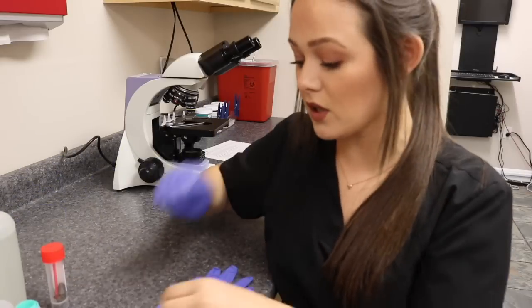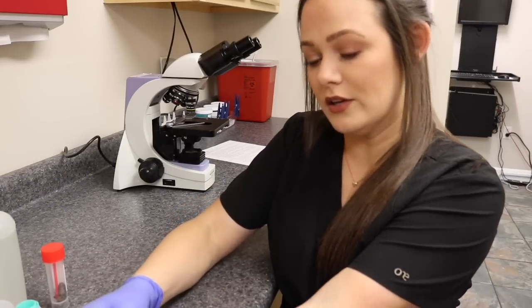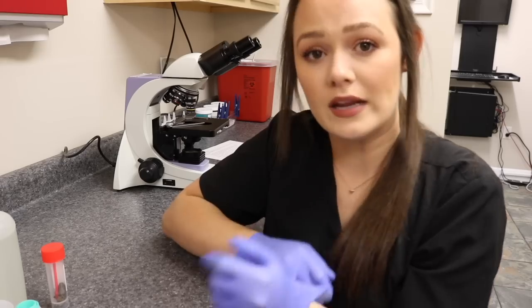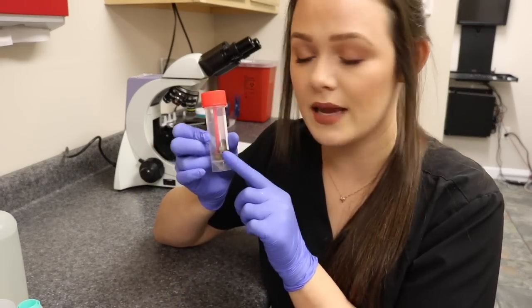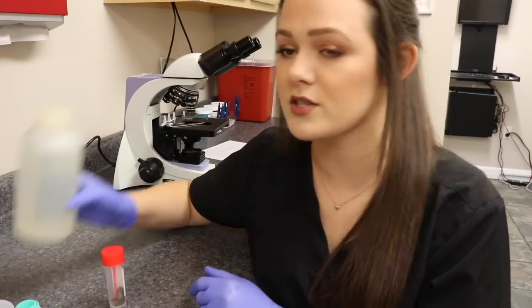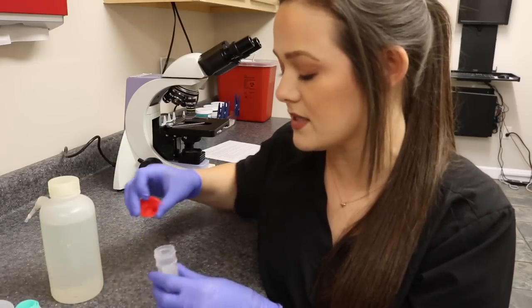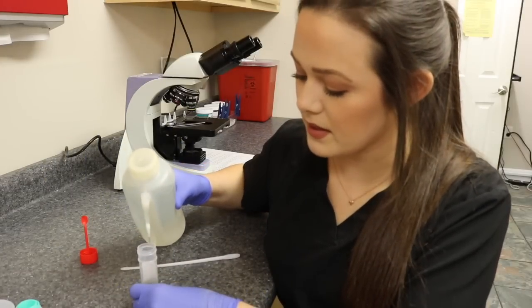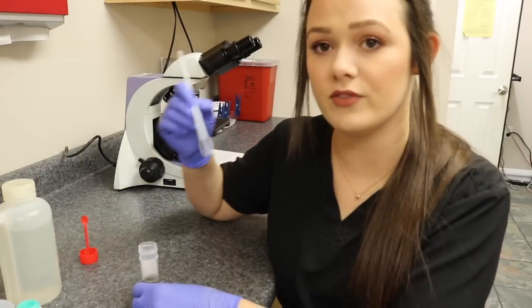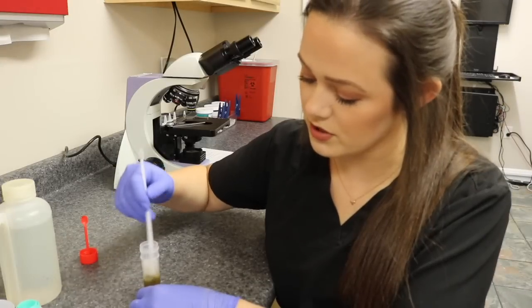The first thing I'm going to do is put some gloves on, because when you're handling fecal material you're always at risk for getting a zoonotic disease. I do have a 2 gram sample here and also some sodium nitrate solution. This is what I'm going to use to float the sample, so I'm going to take the fecal sample and mix it in this container, then just take a fecal loop and mix the sample with the solution.